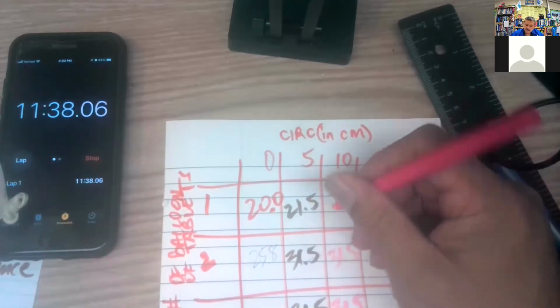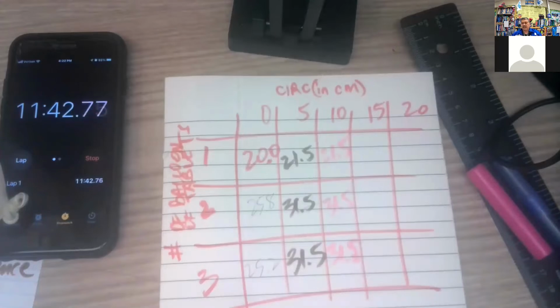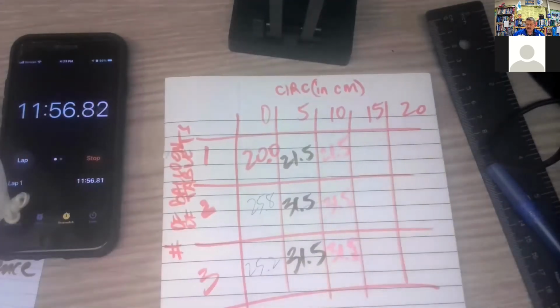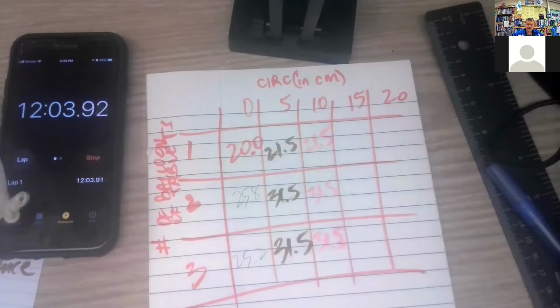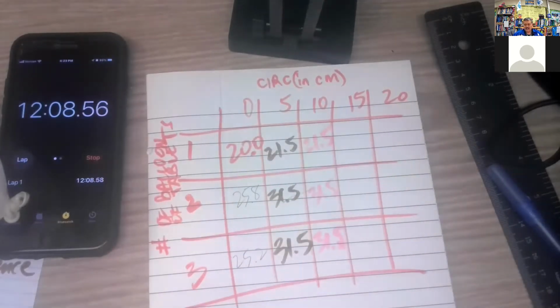So I think that our reaction has peaked out. So I wonder if we can try it one more time with number 3. While we're doing that, I'll still do the 15 measurement and see if we get the same numbers at 5 and 10. Looks like it goes pretty quickly and then maxes out at 5 minutes.